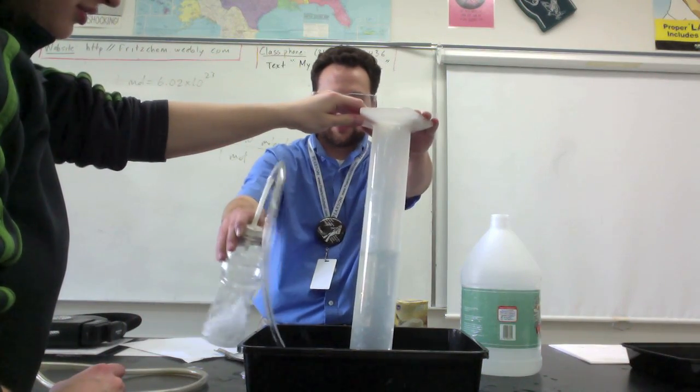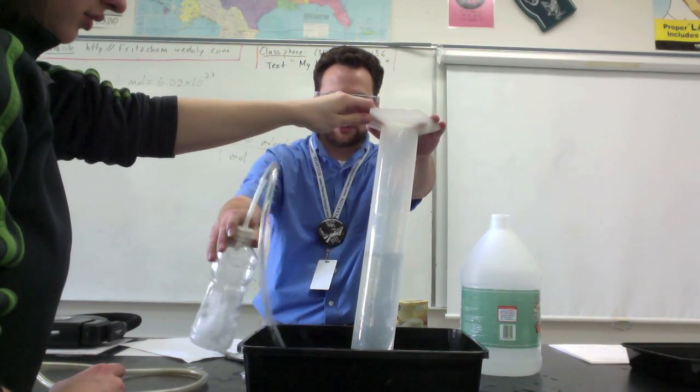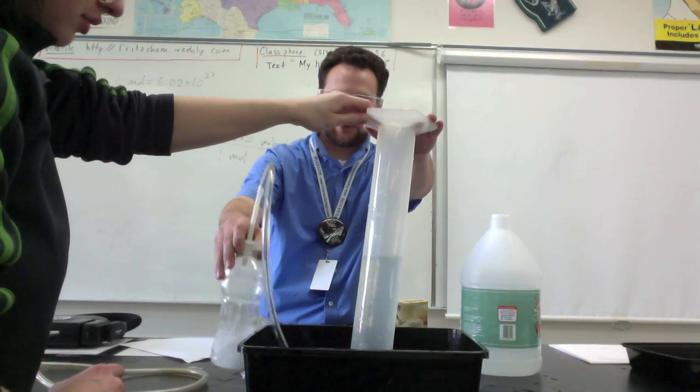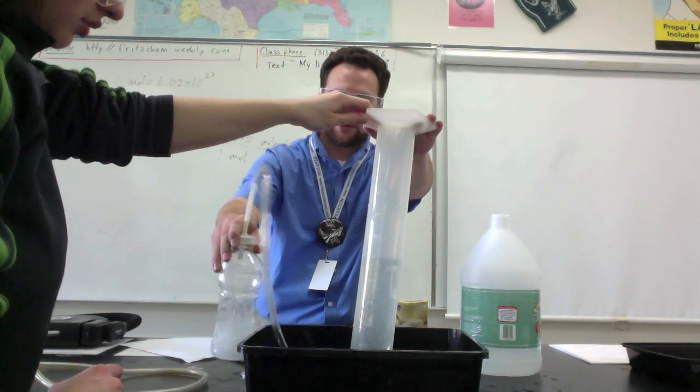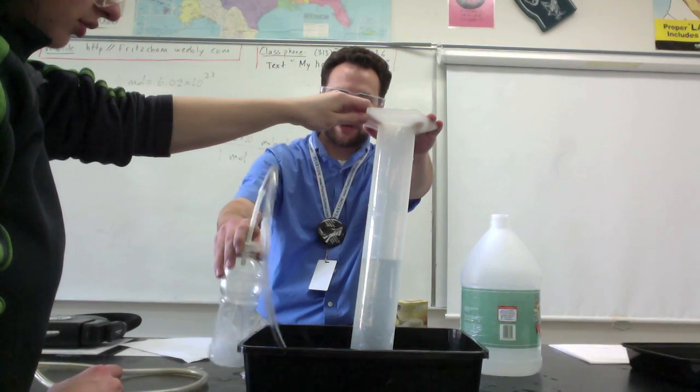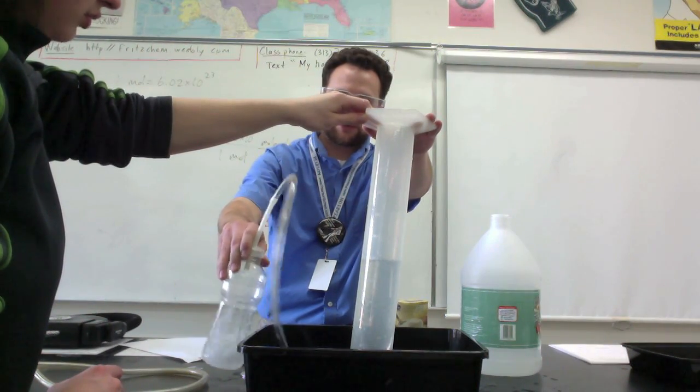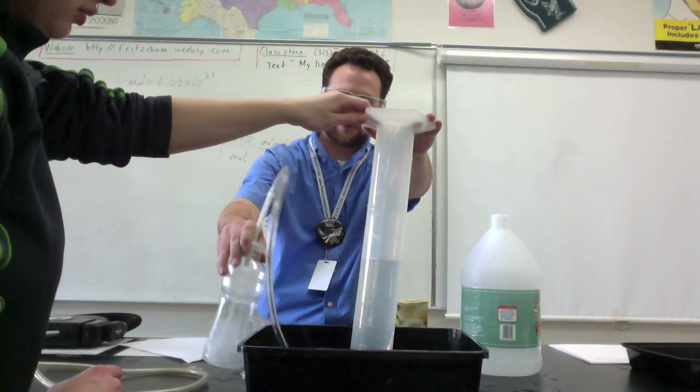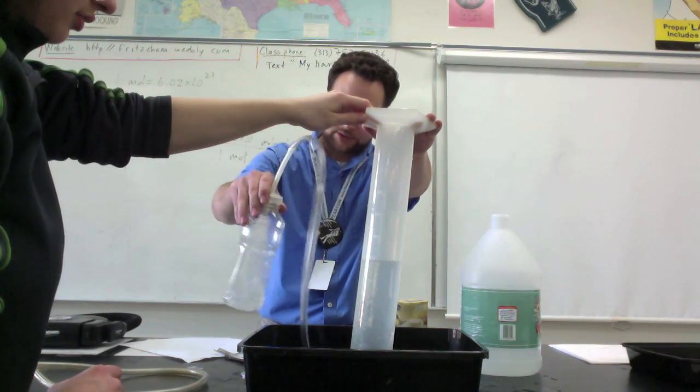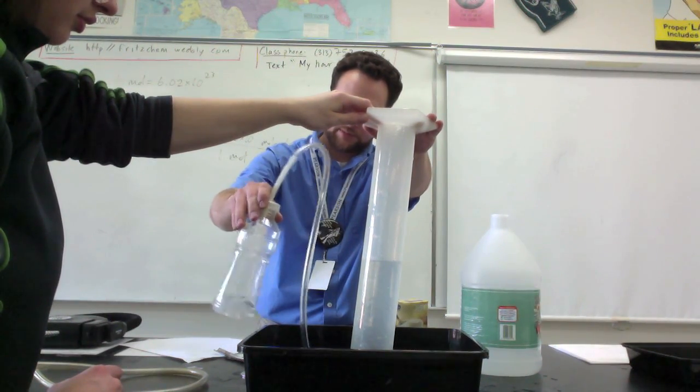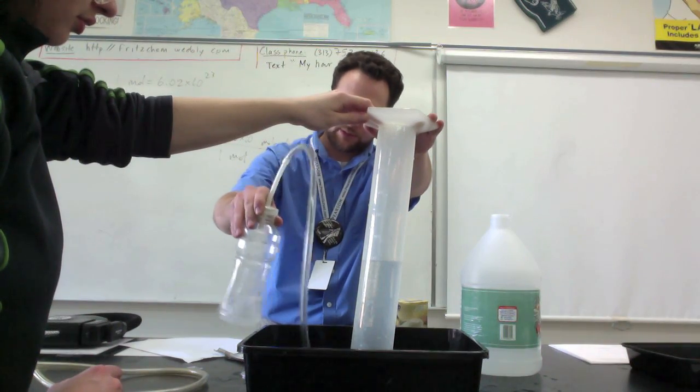And you can kind of see, you want to be careful not to pinch it too much, because then the gas won't be able to come out. You want to shake it until the point where all the bubbles stop being produced. So that'll tell you that all the baking soda's reacted with the vinegar. And so I got a little bit of bubbling going on down here, so it's pretty much reacted, but now it's pretty much done completely.